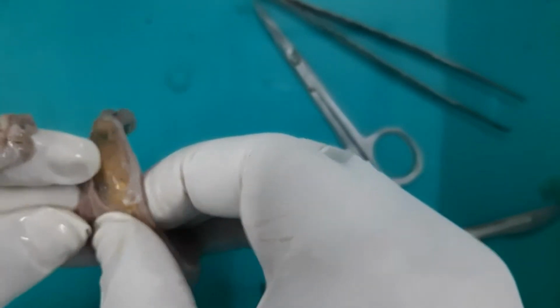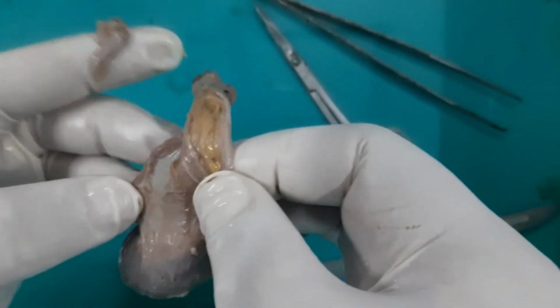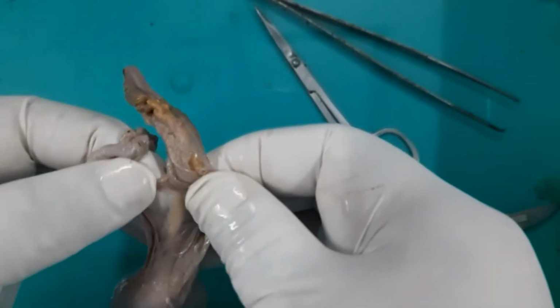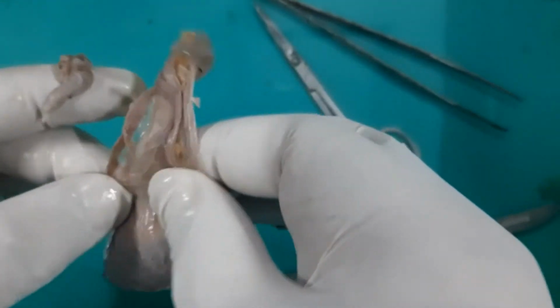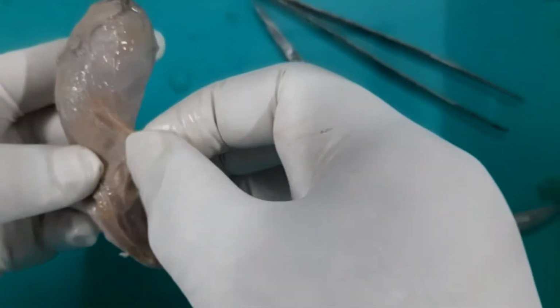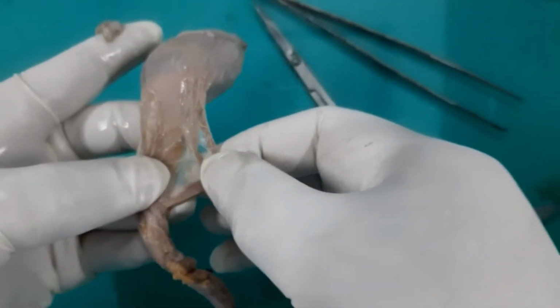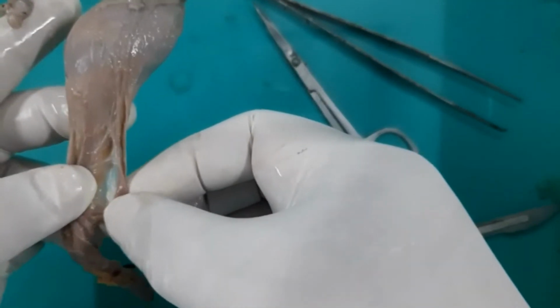Again, as I said, there are adhesions between the cremasteric muscle and its fascia and the deeper fascia, that is the internal spermatic fascia. Now you can see some of the part I could remove, that is the cremasteric muscle and its fascia, as from the spermatic cord it is continuing on to the testis. You can see here some of the muscle strands. See this? Can you see this muscle? These are the muscle bands.